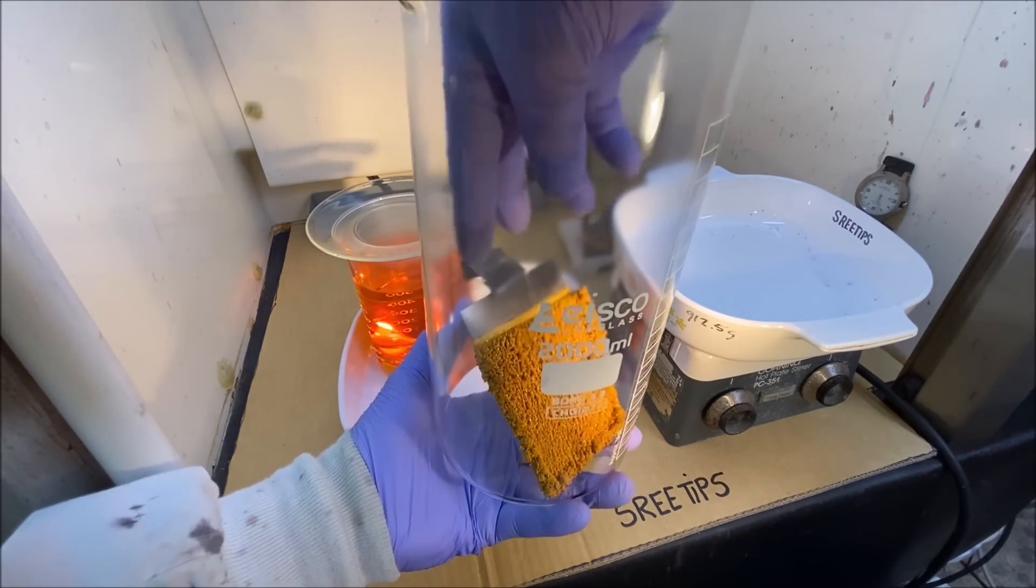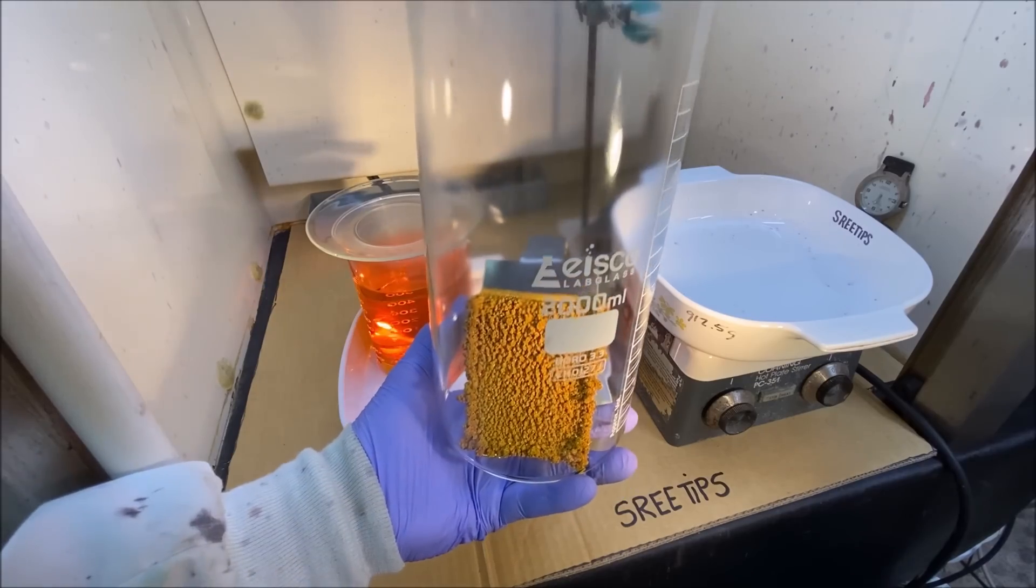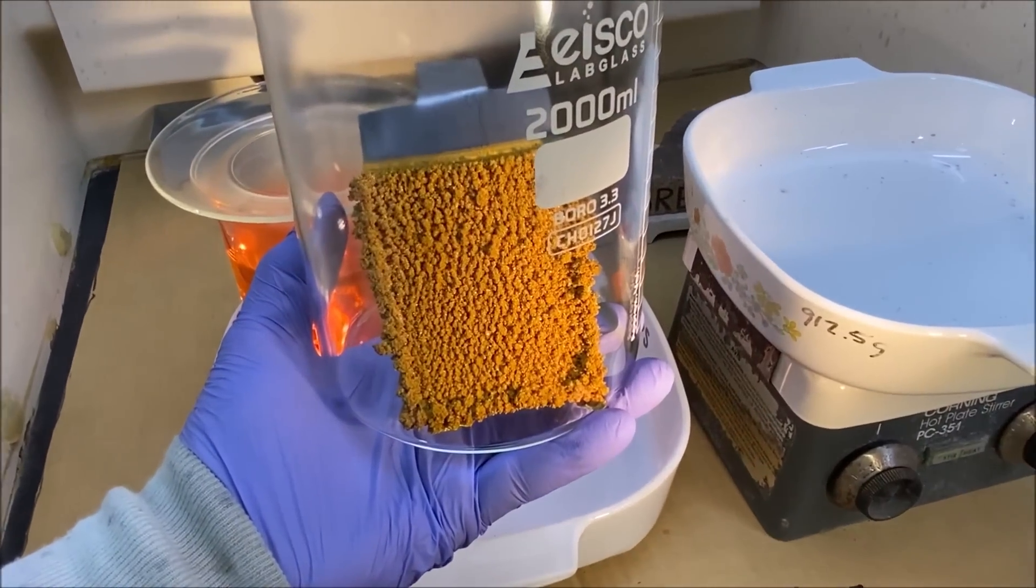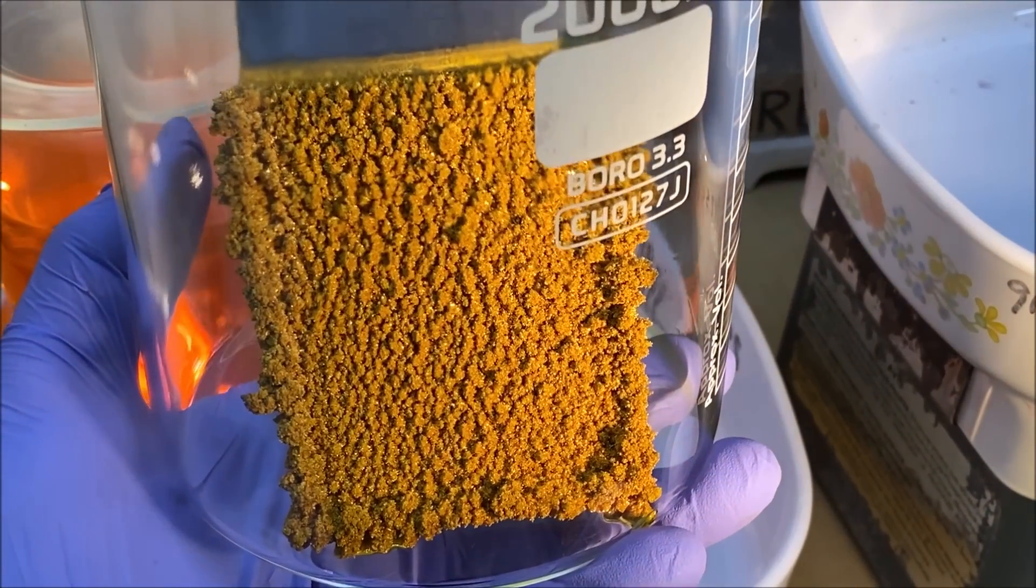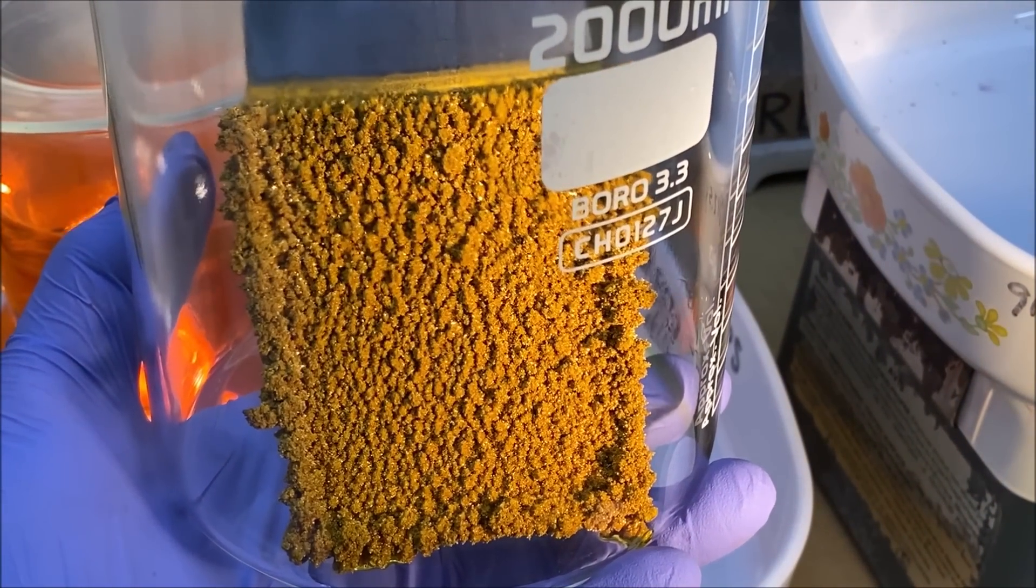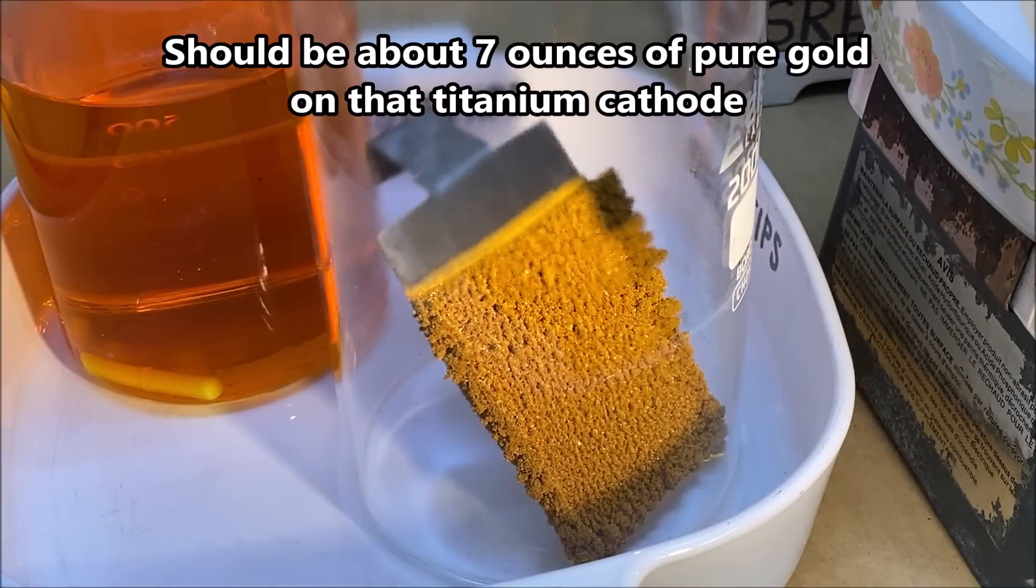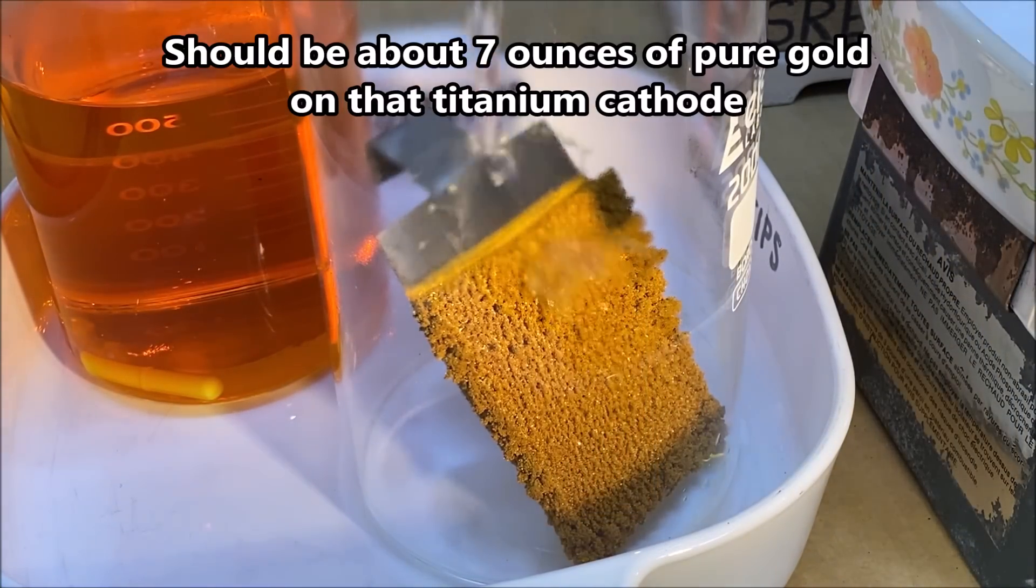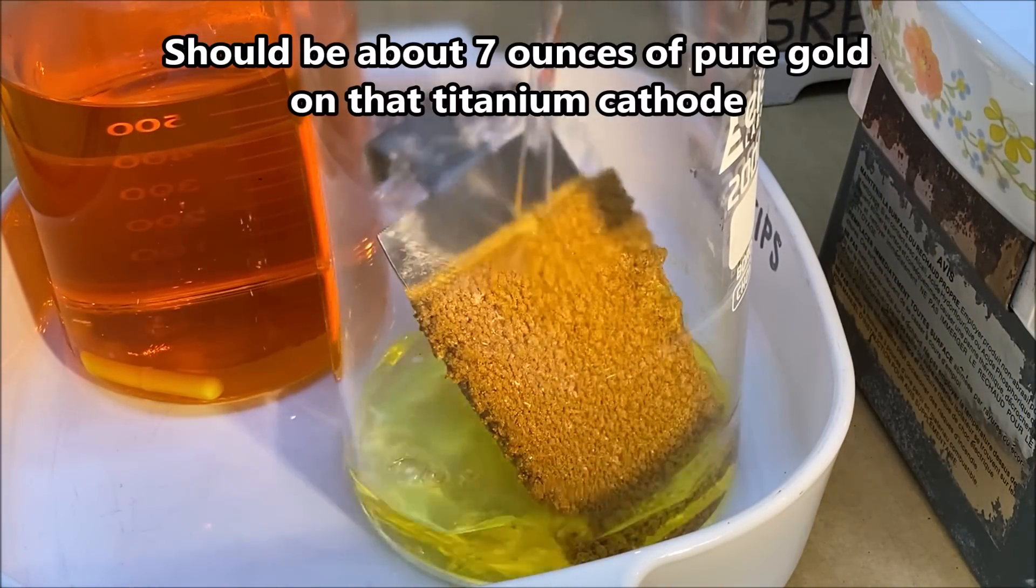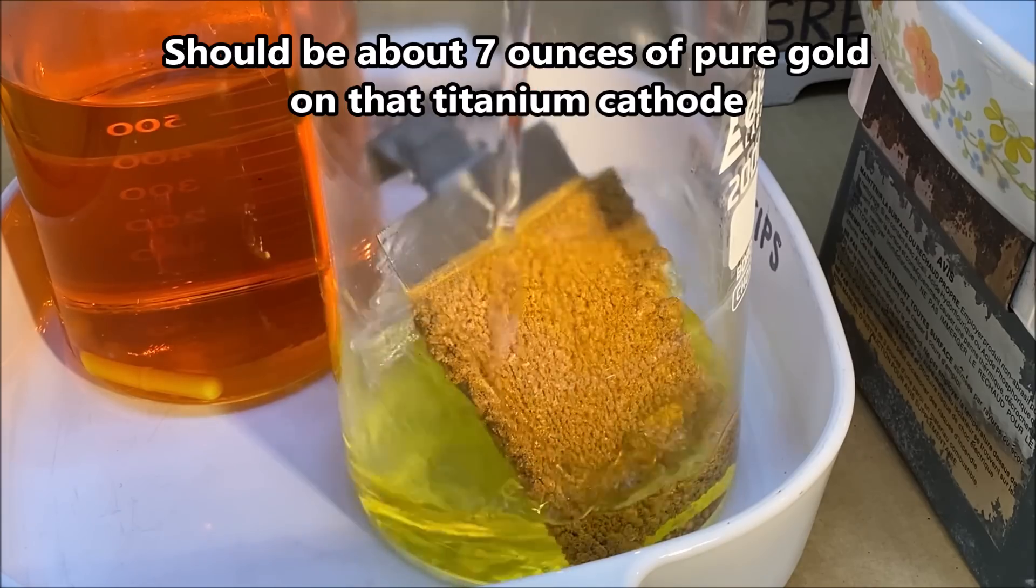Here's our prize. This is going to be the high purity, four-nine fine pure gold. I'm just going to cover this with some distilled water. All that electrolyte will have to be rinsed off of there.